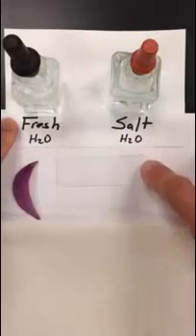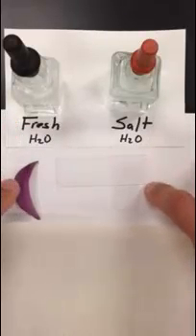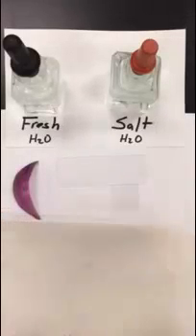So what you need at your station are the following. You need bottles of fresh water and salt water. You need a microscope slide, a cover slip, a piece of red onion, and a piece of paper towel.